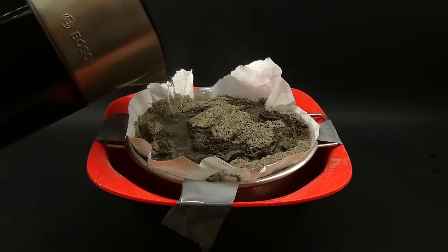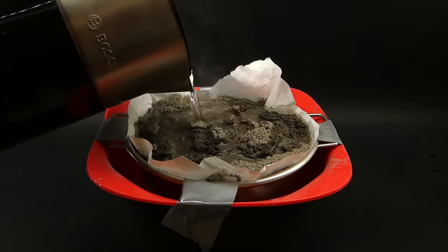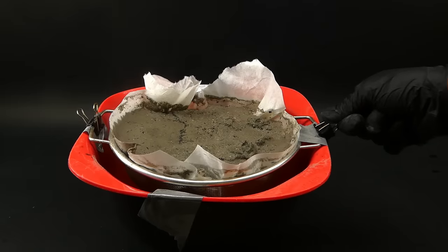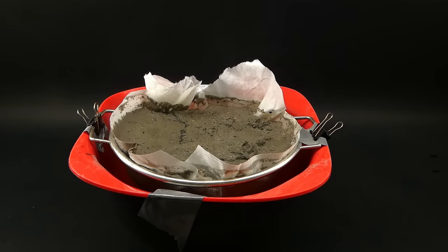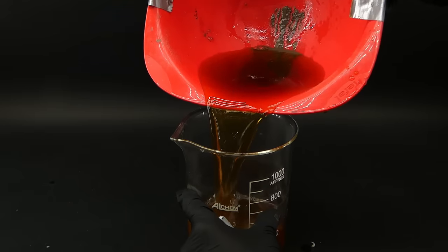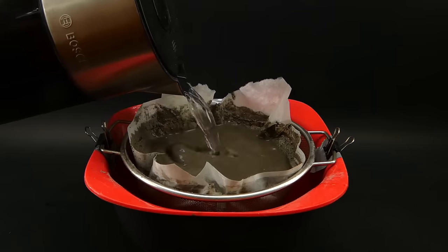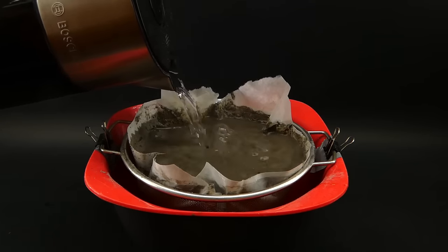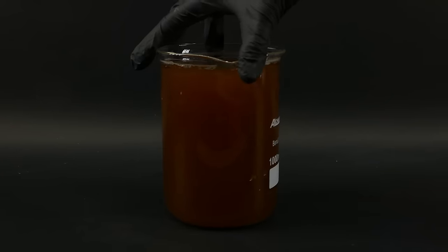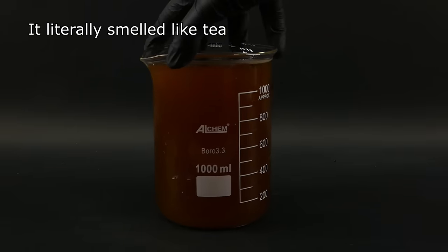Now to get the potash out of it I wanted to improve and use a little bit different method than the last time. So I first turned my sieve into an extra large filter using this comically huge sheet of filtration paper that I possessed for some reason and taped this contraption to a large bowl. I then filled it with all the ash and poured in some boiling water to leach away all of the potash.